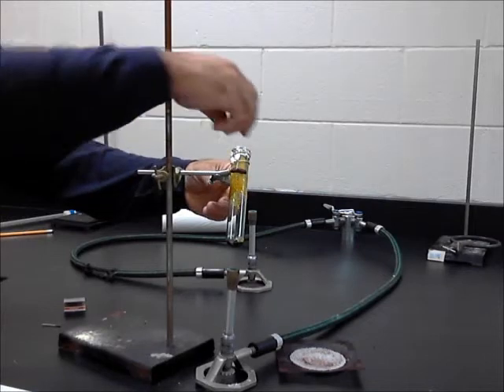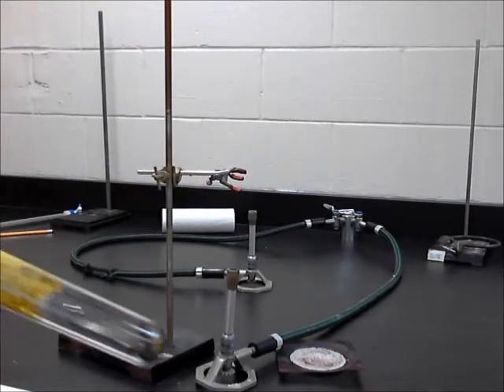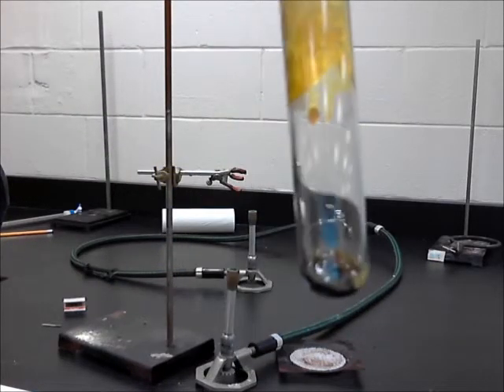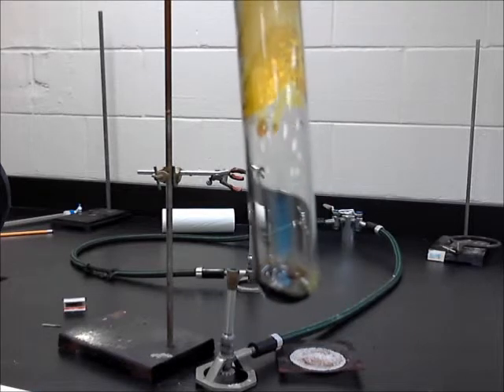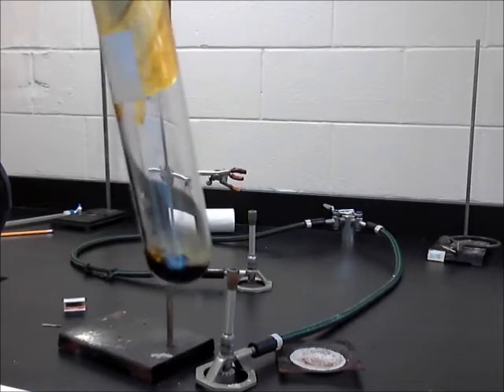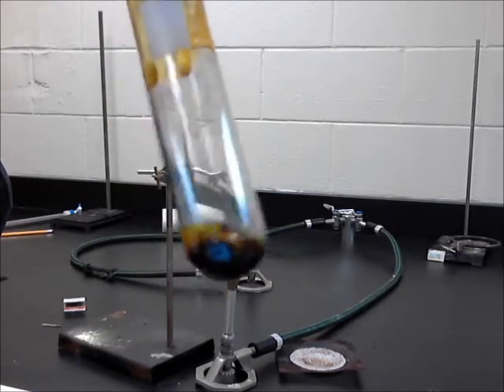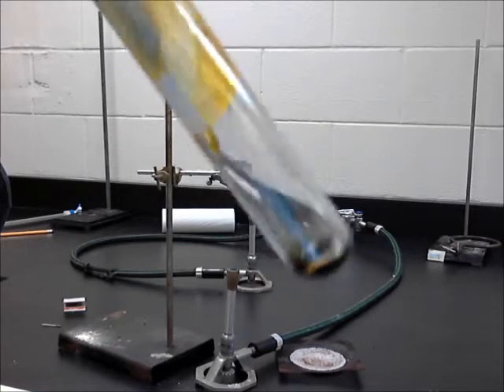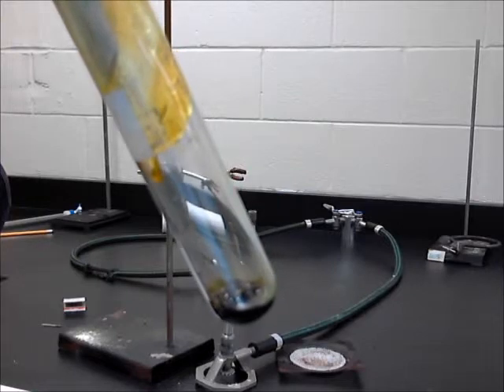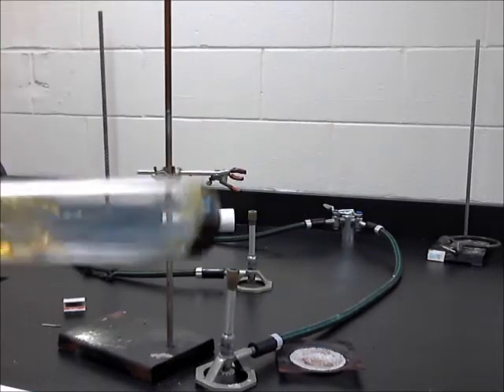I'm going to pull this thing out of here and give the camera a little better view of it. In this case, you'll see it's an interesting little substance there. It cleaned the bottom out nicely. I bet if I wanted to clean these test tubes, I could probably use heat to clean them out. But we have a new substance in there that looks like it has some new properties. It has not cooled sufficiently for me to get it out of here yet, so it's definitely going to take a few moments.